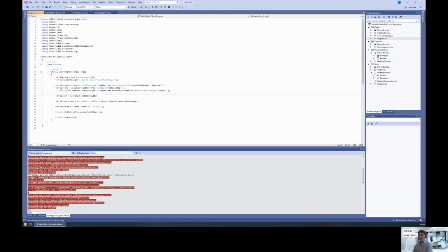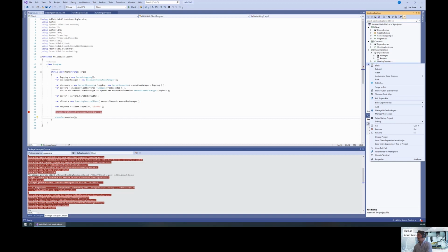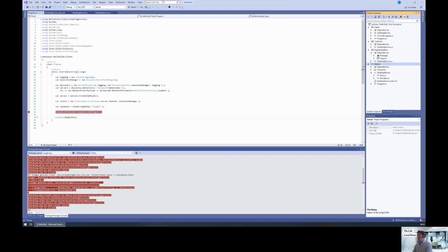Now we still have the same client code. So we are going to find the server via discovery, create a client, and say hello. And the response now is a dynamic object property. We can, of course, also just write-line the response, but I'll put a breakpoint here. Okay. And then we can start the server. So let's build the solution first, make sure everything's working. And then we can start the server without debug, such that I can use a debugger for the client.